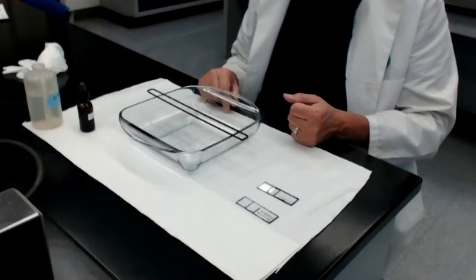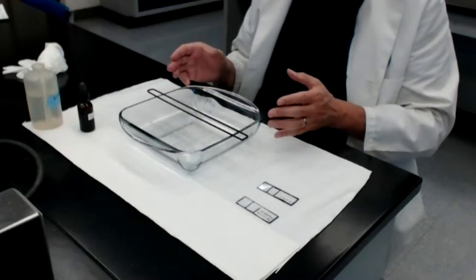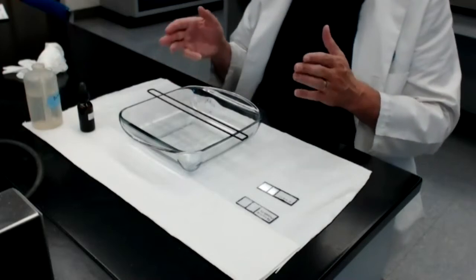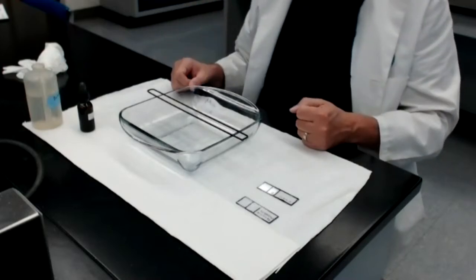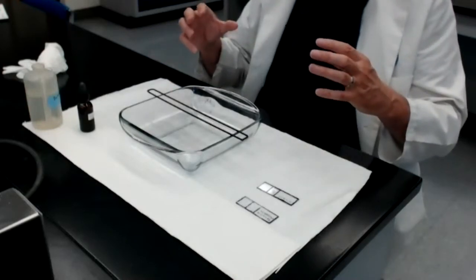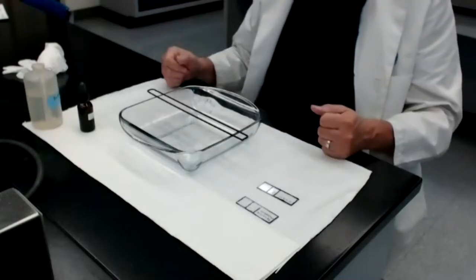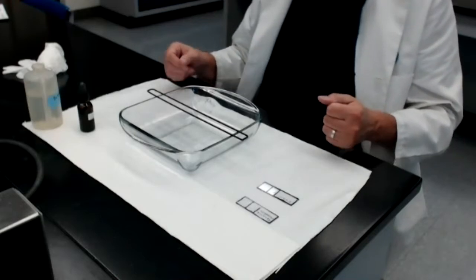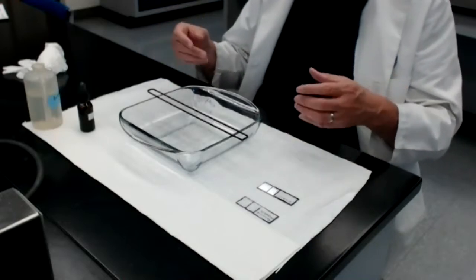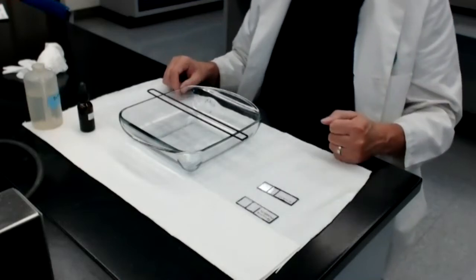Third category of stains would be structural stains. These are staining protocols that are designed to impart color to specific bacterial structures. For example, there's the flagella stain that will give color to bacterial flagella. There's a capsule stain. Many bacteria have capsules that surround them. That's a structure. The capsule stain gives color to the capsule if it's there. Cell wall stain uses a dye that imparts color to the bacterial structure called the cell wall. Those are all examples of structural stains.